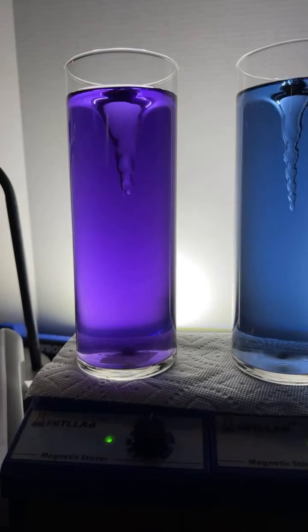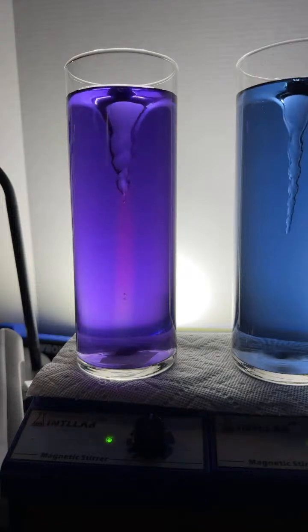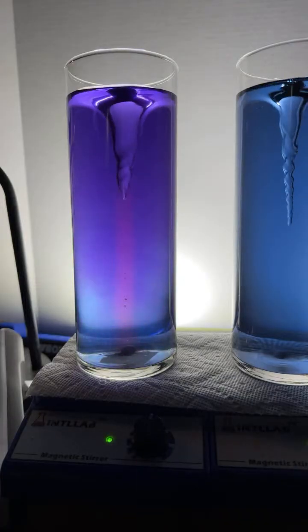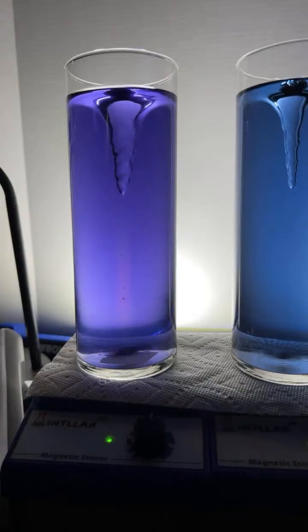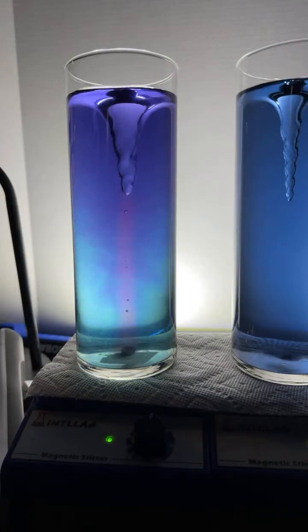Okay, here we go. This is the 4th drop, yeah? In goes the 4th drop. In goes the fifth drop, probably a bit prematurely, but I'm going to add it anyways. There's the fifth drop. We're doing a titration. All right, in goes drop number 6. We're trying to get to green. Drop number 6.